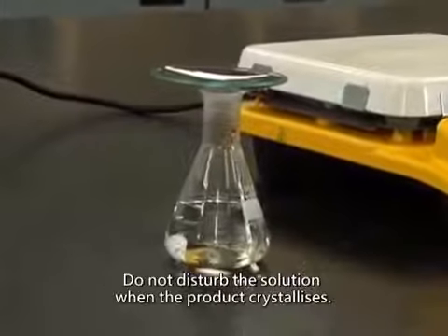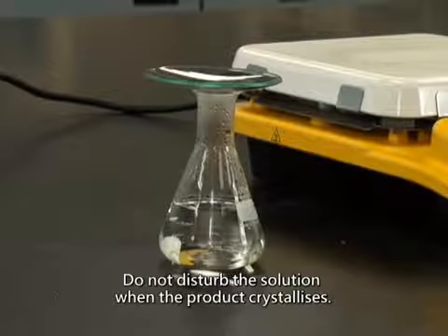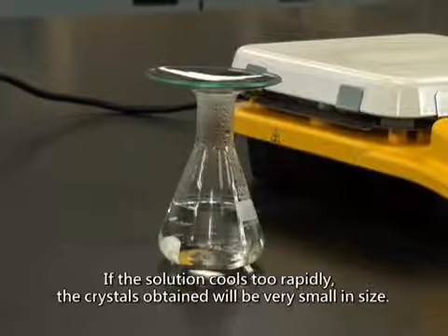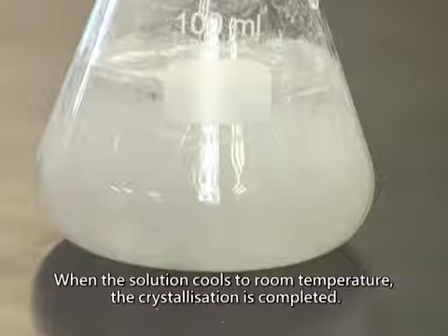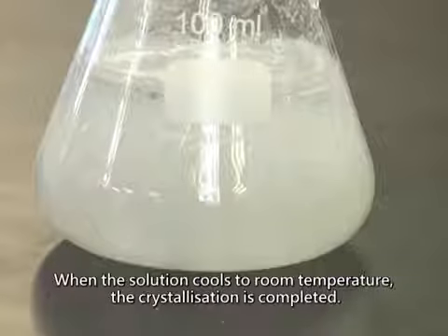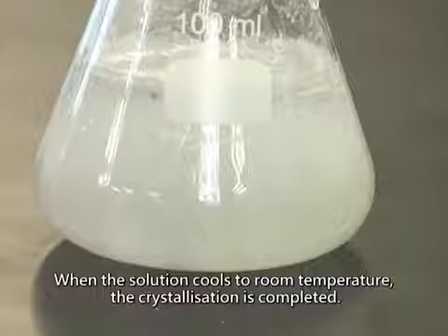Do not disturb the solution when the product crystallizes. If the solution cools too rapidly, the crystals obtained will be very small in size. When the solution cools to room temperature, the crystallization is completed.